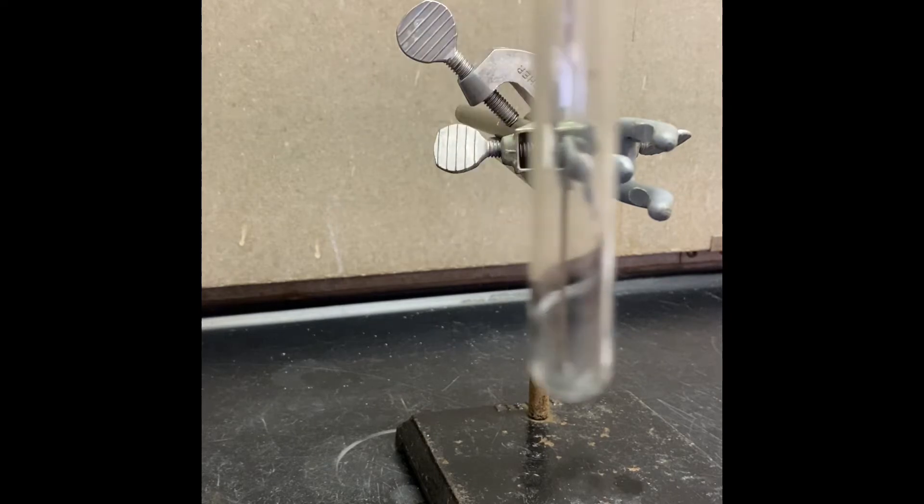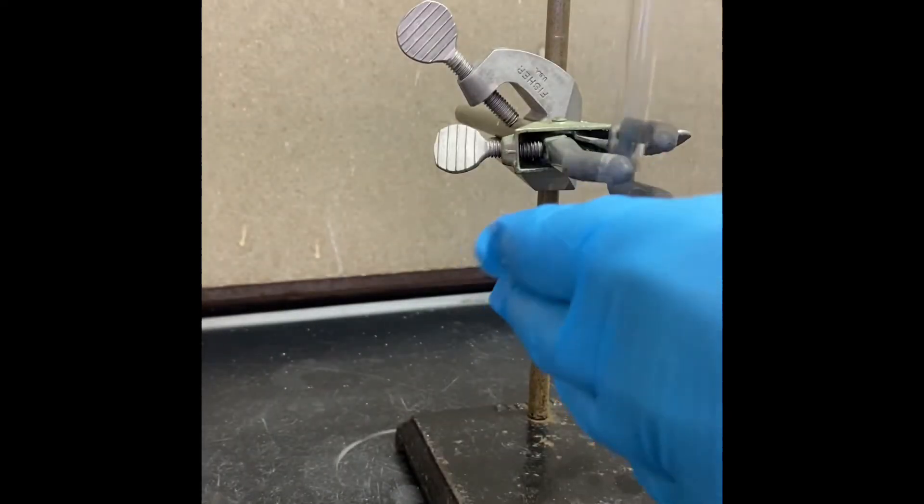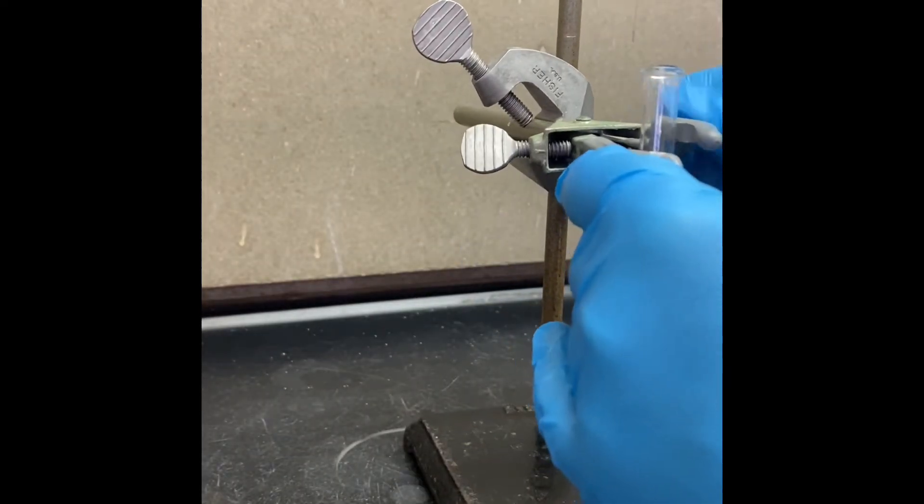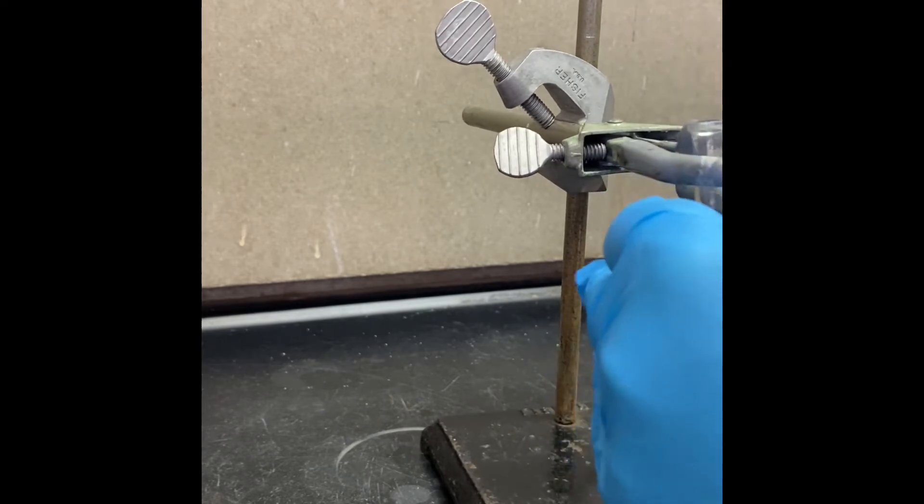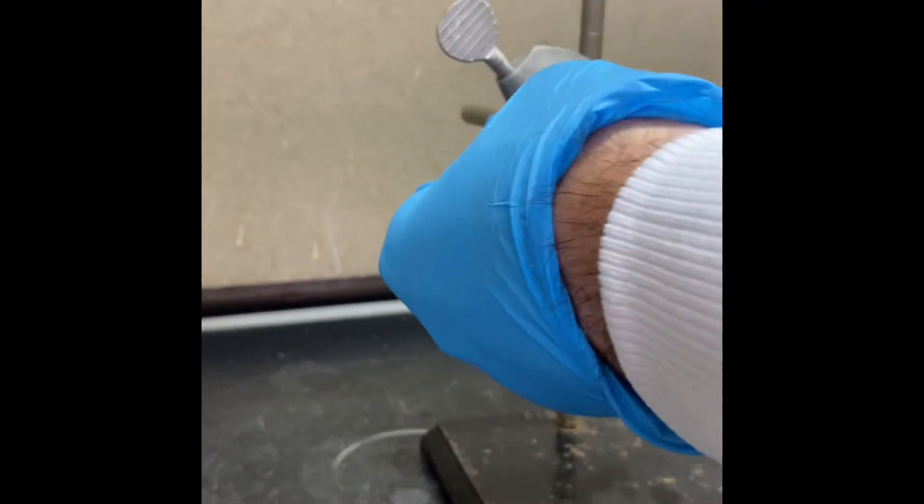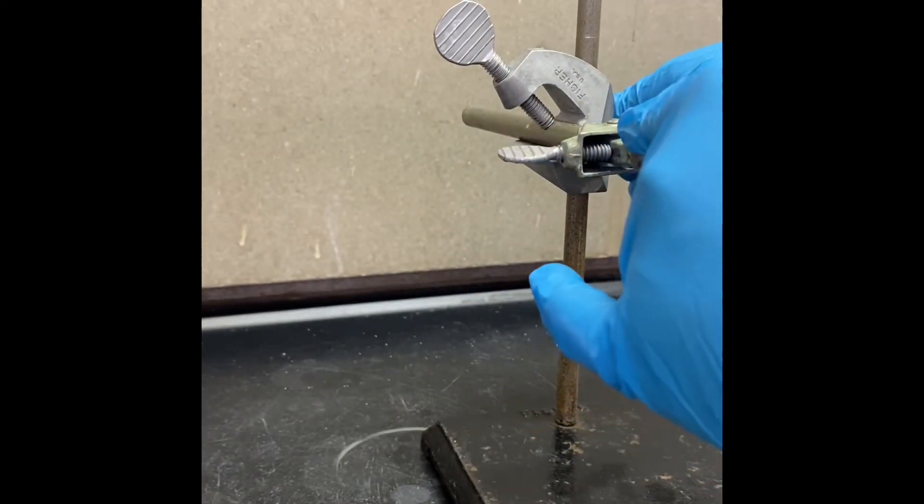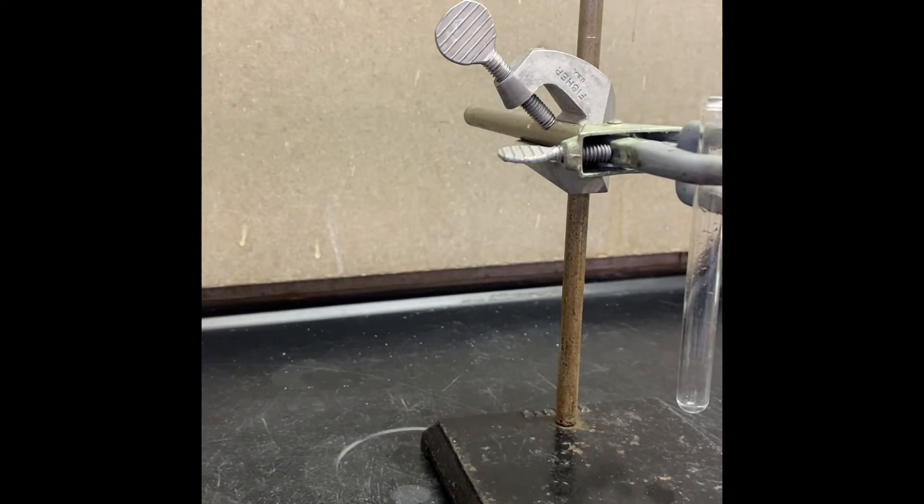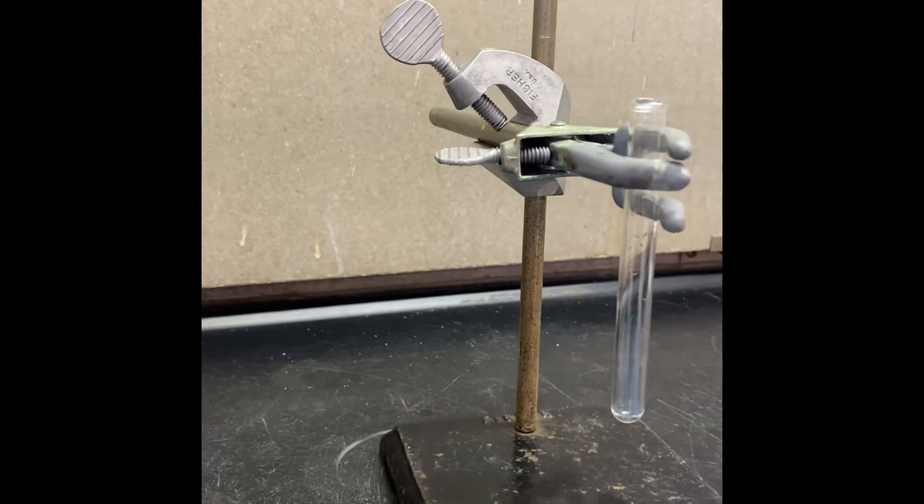Our reaction flask is going to be our test tube. We are going to work micro scale. So I just want to adjust my reaction flask and I am going to transfer my reagents in our reaction flask.